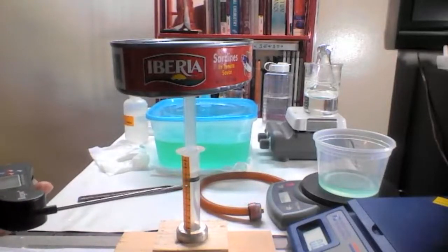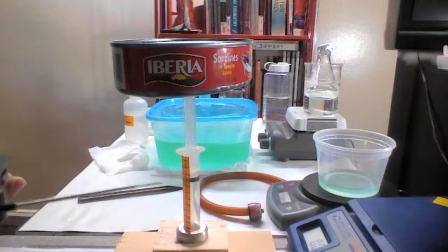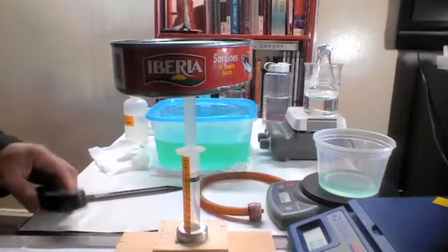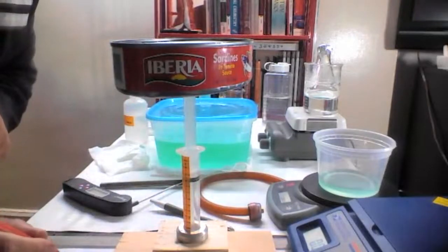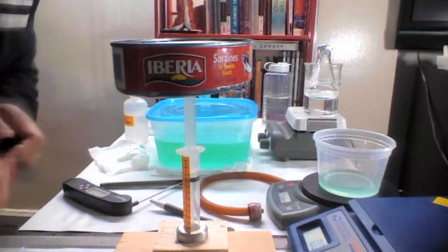So that's between 8.5 and 9. We're going to take it as being 8 and 3/4 of a milliliter, 8.75, so that we just do it as accurate as we can. So we have 8.75 going from 11.25 milliliters.